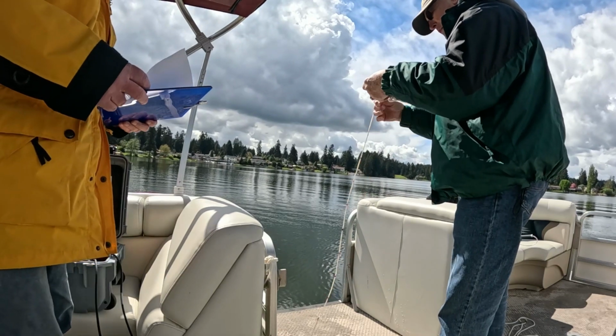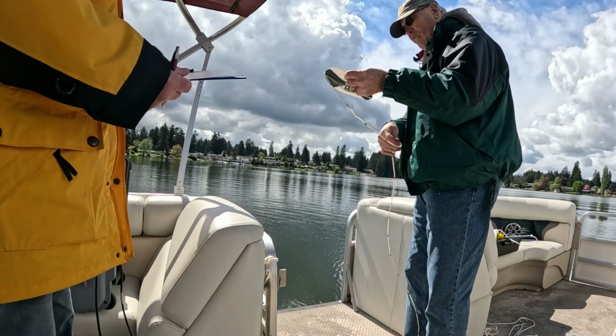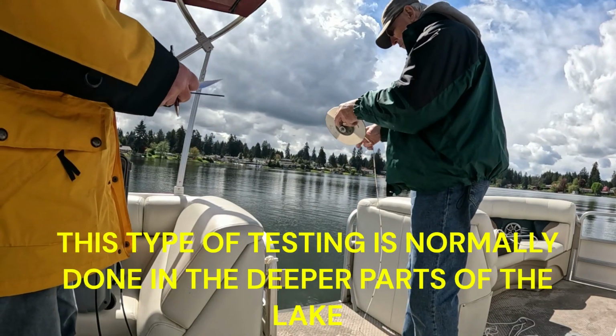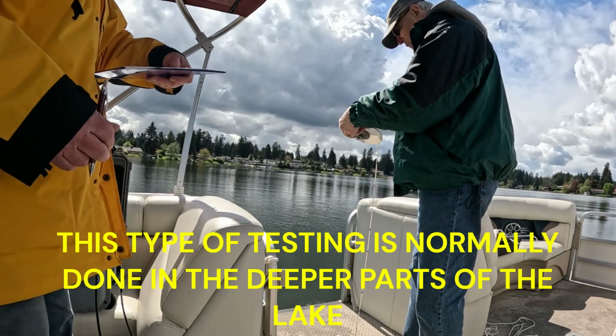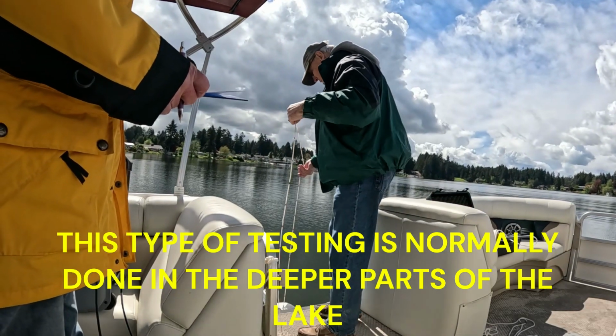We're at Long Lake, location number 2 in the North Basin, getting ready to do water sample testing, Secchi disc testing.